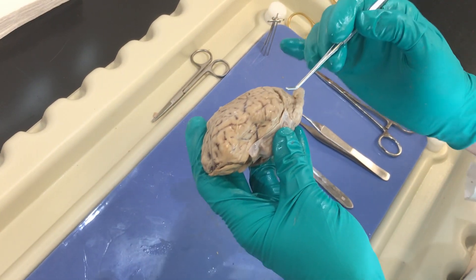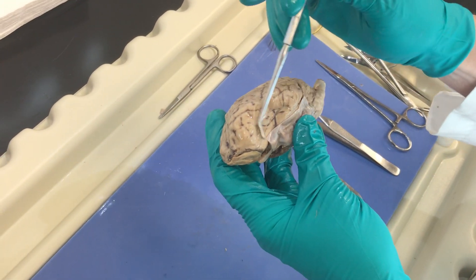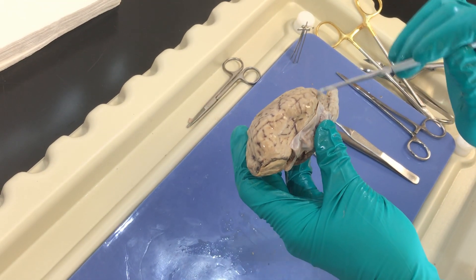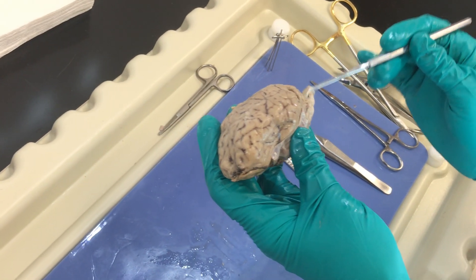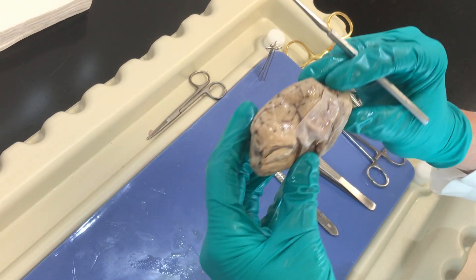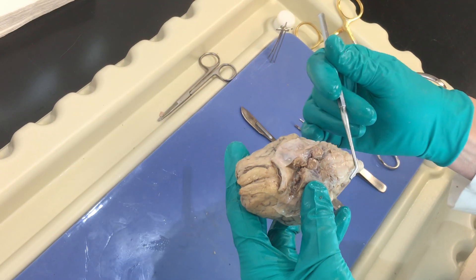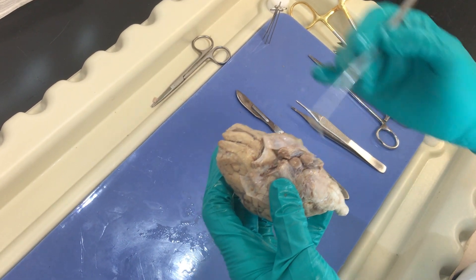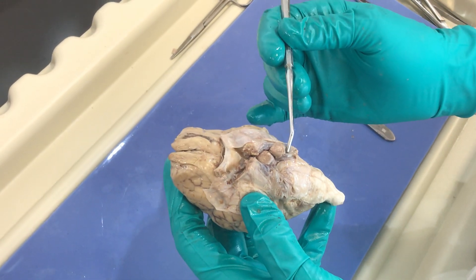From the side view, we have our temporal lobe, frontal lobe, parietal lobe, occipital lobe, and then the cerebellum, and extending away from the brain we have our spinal cord. If I take the brain and turn it about 90 degrees, we can see the underside of the brain. This is anterior and this is posterior — or cranial and caudal if we're talking about a sheep.